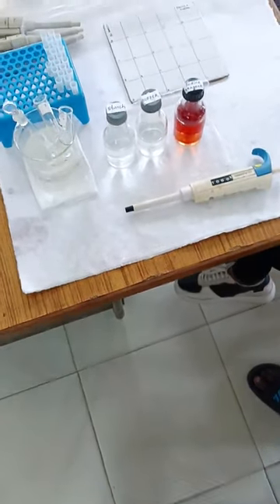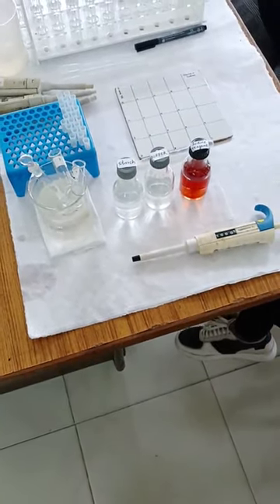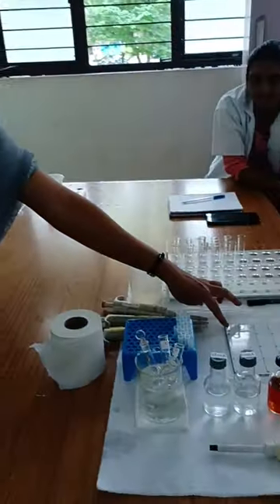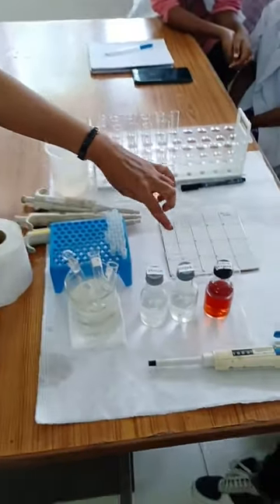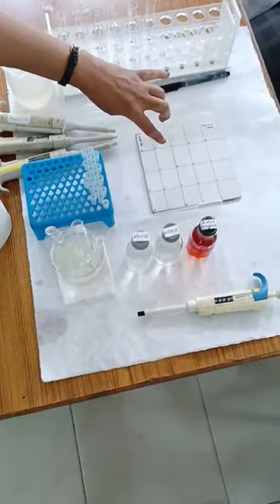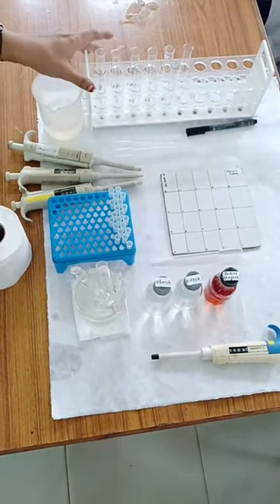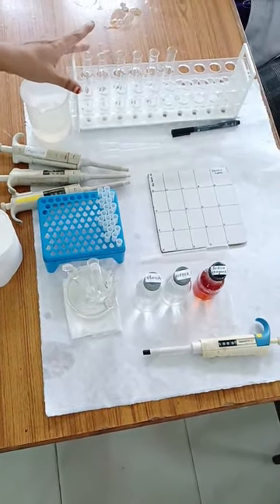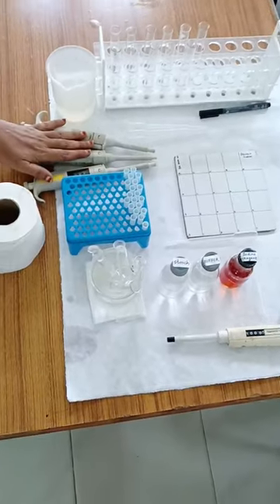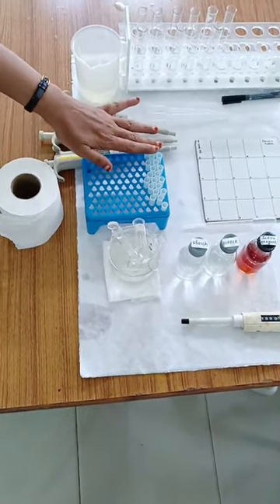The next reagent required is iodine, which is used for performing the experiment. We also have a tile where times are marked in the range of 0, 1, 2, 3, 4, 5 minutes. Different time intervals are entered on the tile along with a set of test tubes to prepare the reaction mixture, and micropipets with tips to take the required aliquots.